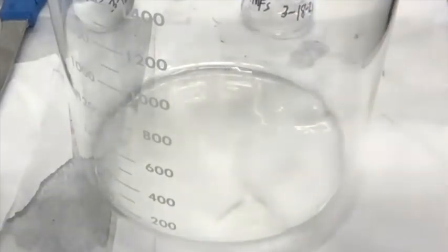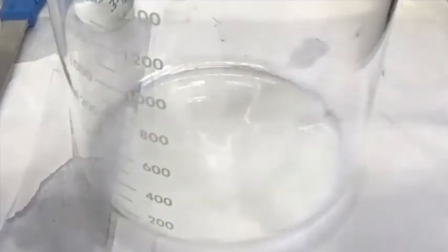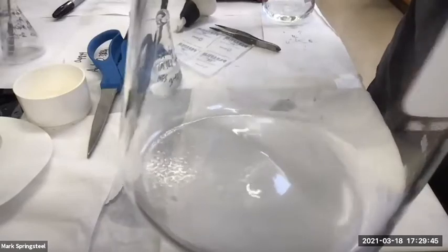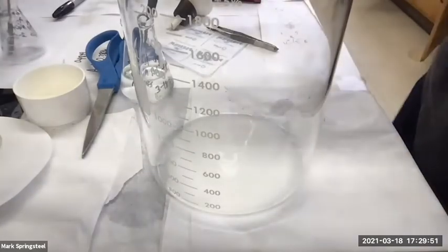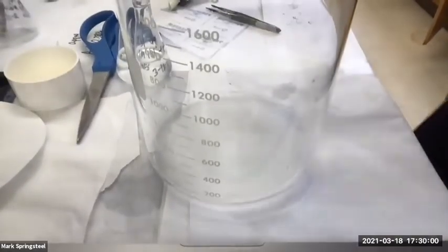And this, do you think I've quenched it? Does it look like it's no longer acidic over here? Any evidence of excess bicarbonate? Yeah, I've got excess bicarb. It looks like it's quenched. Now I'll do the second one too. This is the second acidic layer from the filtration. This one's a little less acidic. It fizzed a little bit.